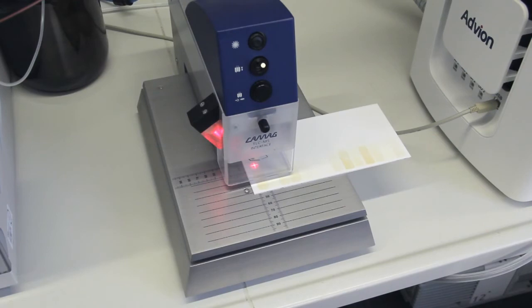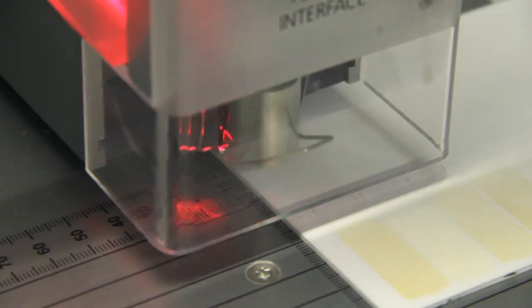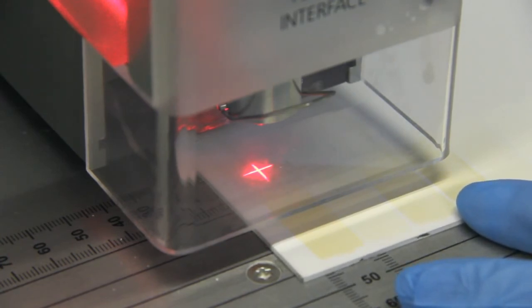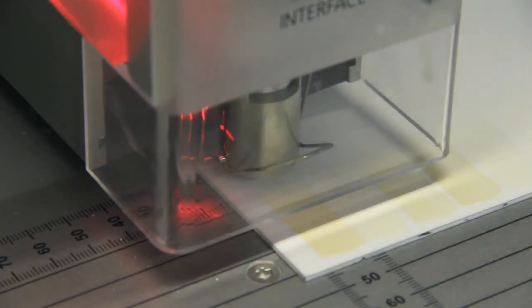Directed by a red laser cross, the zone of interest was positioned below the oval elution head. After elution of a blank representing mass signals of plate background, solvents and MS system, the zone of interest was eluted at a flow rate of 0.1 ml per minute using a 49:1 mixture of methanol and a 10 millimolar ammonium formate buffer of pH 4.